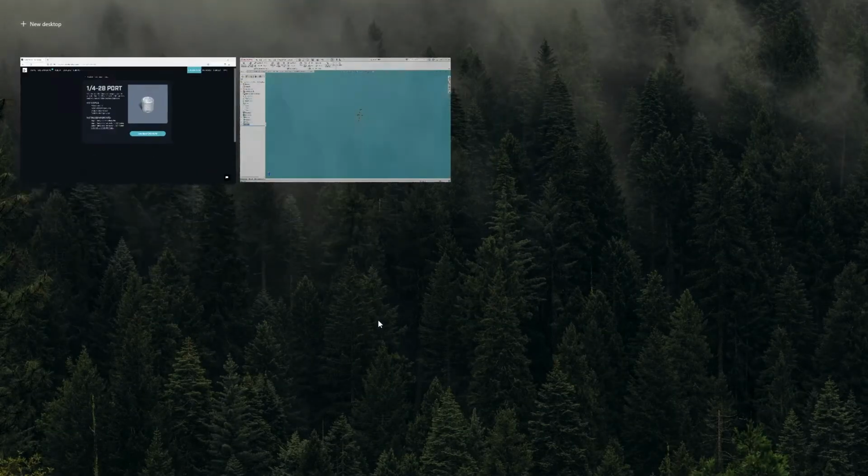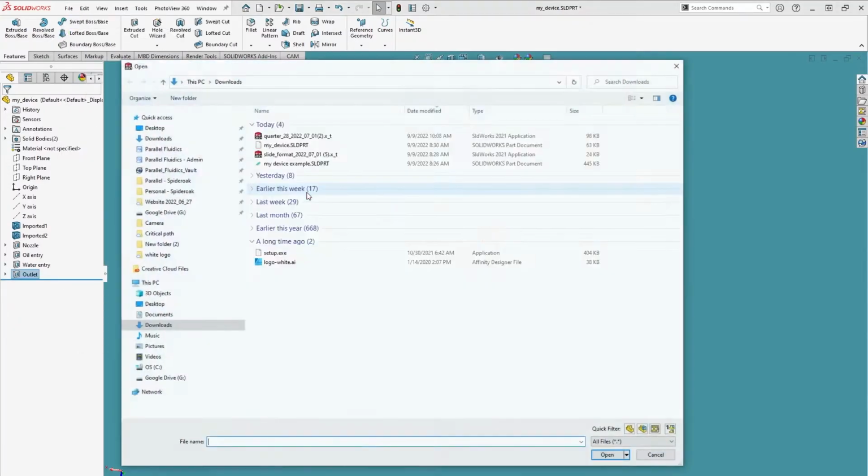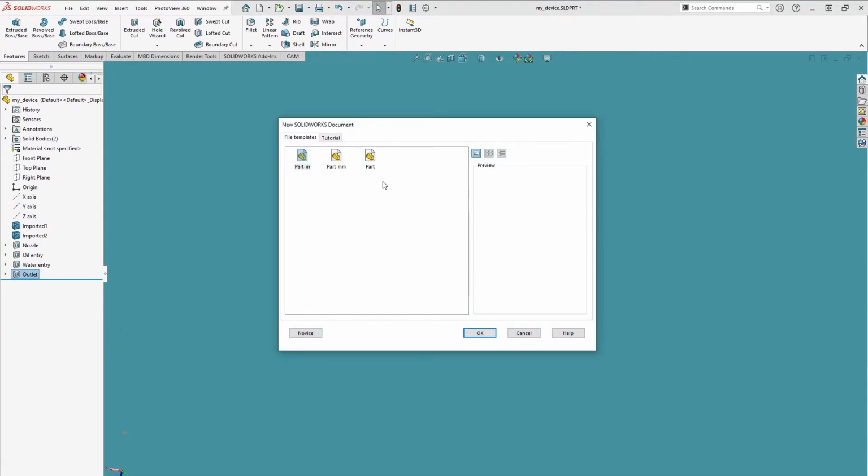Let's click the Download CAD Model button to get a Parasolid file, and then open it up in Solidworks. Now we can refer back to it if we need any more information.